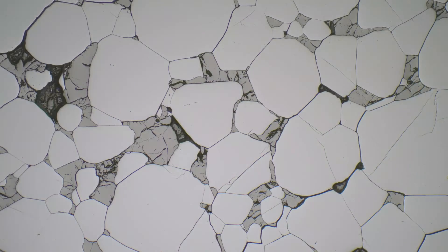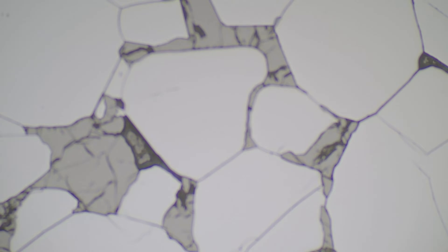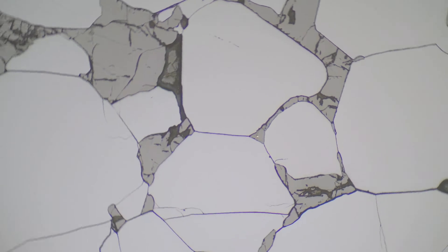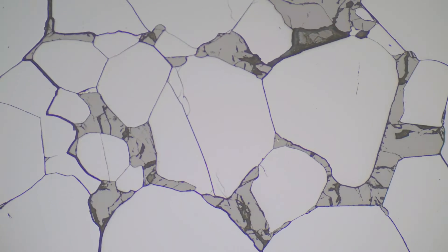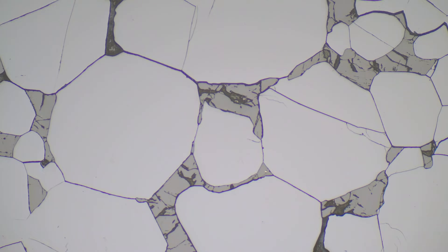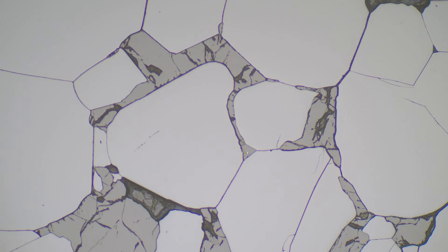Chromite is a non-pleochroic isotropic mineral and it's also quite hard. As we zoom in a little bit and refocus, you can see that it's standing above the other minerals in this slide and that's due to its hardness. Another way to identify it is its quite well-formed crystals, which are one of the more distinctive things about it.